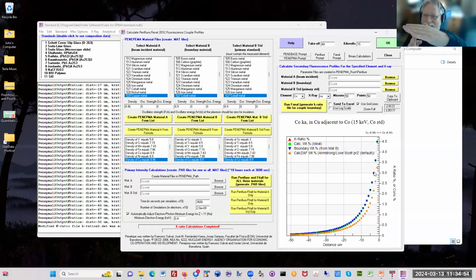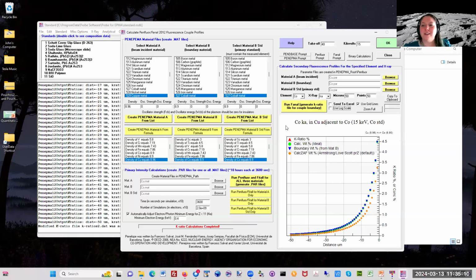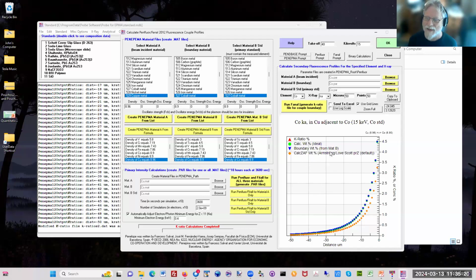parallel to the crystal on the spectrometer, so that as the beam or your boundary moves, it doesn't defocus. Think about it. There's more on the forum about that. You can model it, and then there's a correction in Probe for EPMA to do this in the analyze window. You basically specify a file that you've calculated here, and it will apply it.